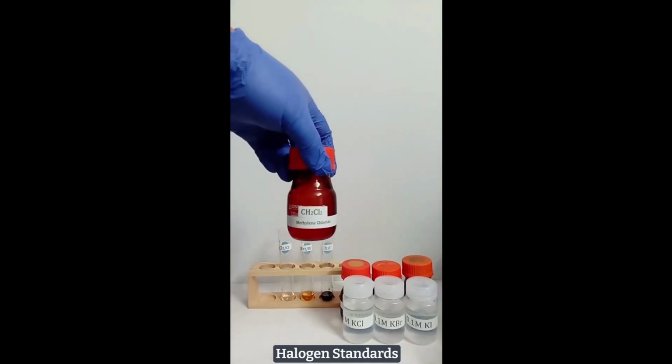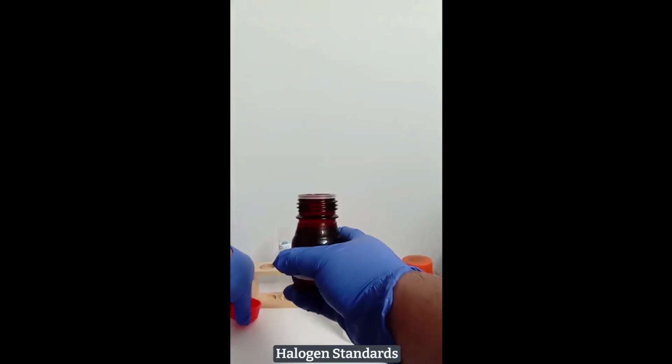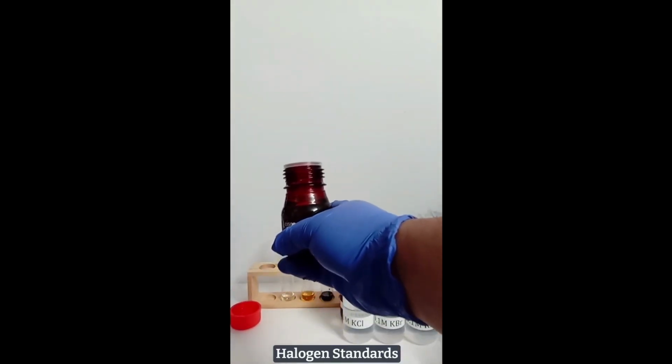Each test tube now gets 1 milliliter of methylene chloride.